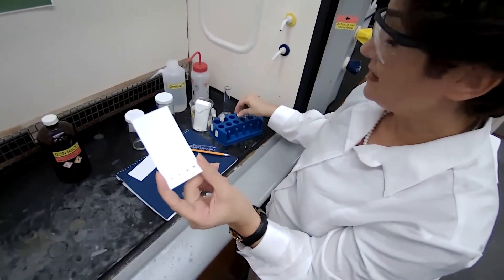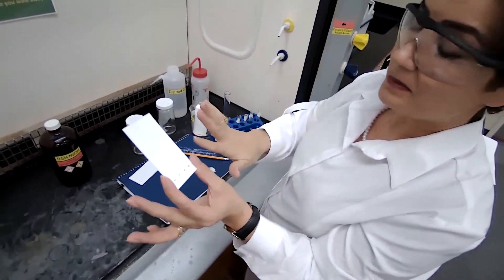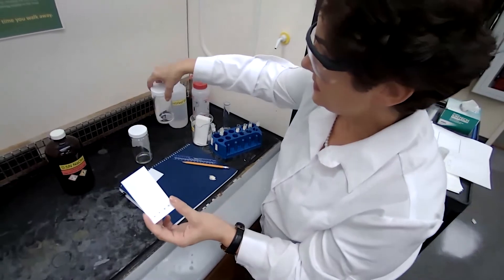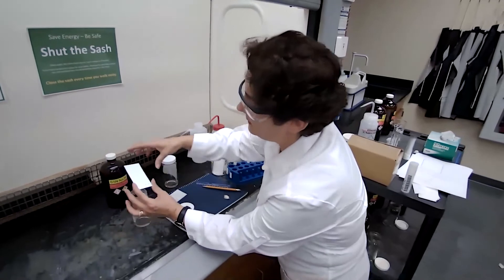Okay, the size of these samples looks better for me. And now my sample is ready, I'm going to place it inside the developing chamber, each one separately.